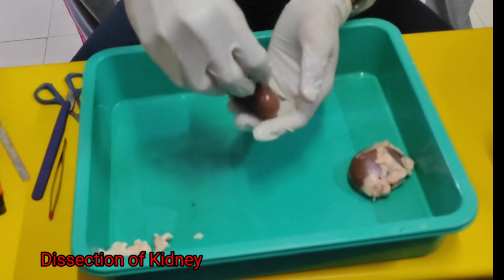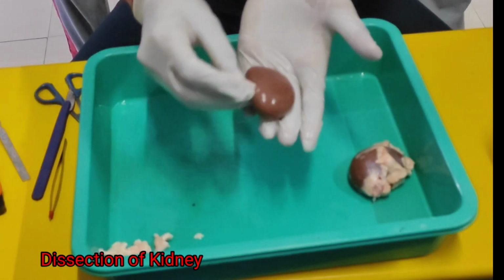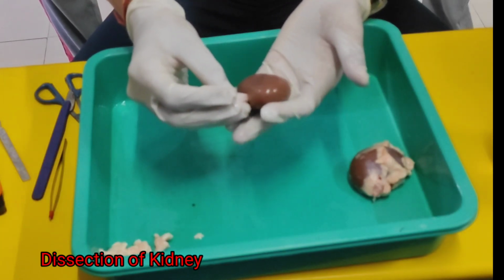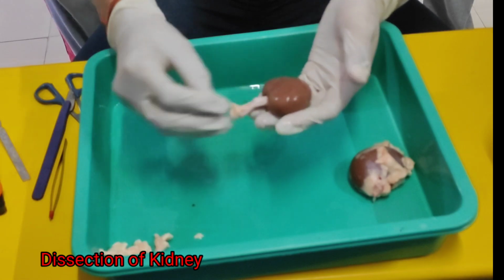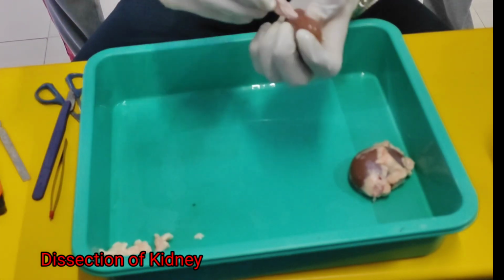These are the actual things after removing all the layers, this is what the kidney looks like. It's a darkish brownish color, bean shape. In Hindi you can say it's Rajma, correct.